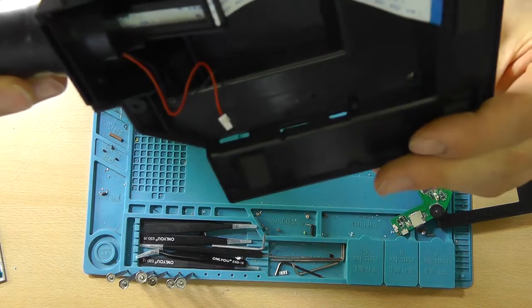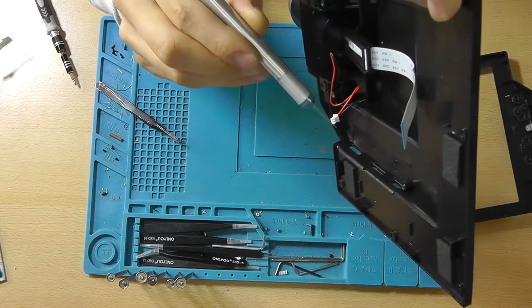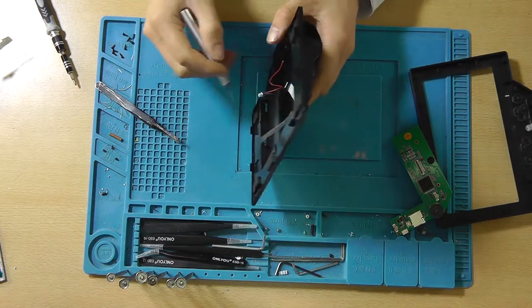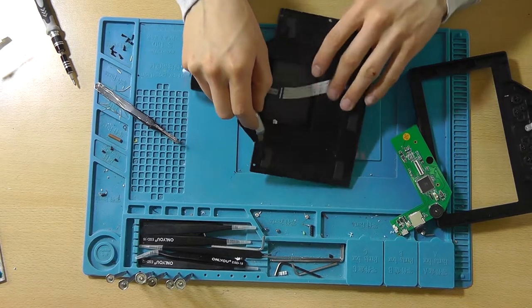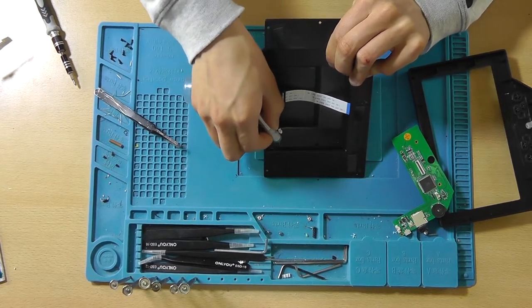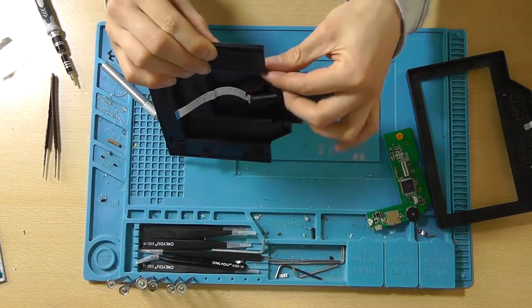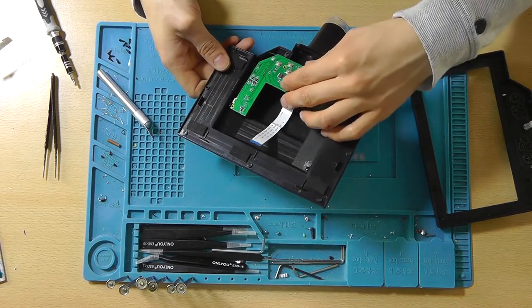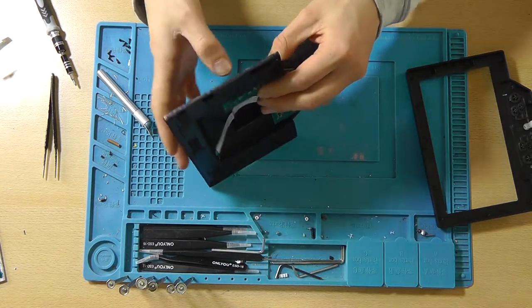As you can see on the inside, there are a few molding residues left over here, a few molding imperfections. So I think that if we can cut those away, we might just be able to have a good fit. Now I'm also going to use a bigger SD card for future recordings, because yeah, a lot of the footage got overwritten when I used the microscope last time, and that was really a shame.